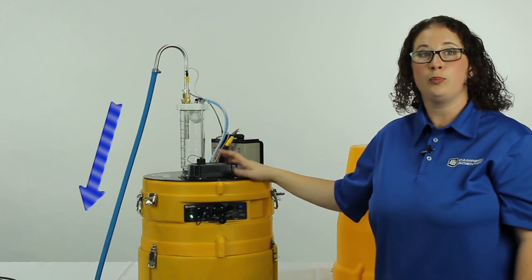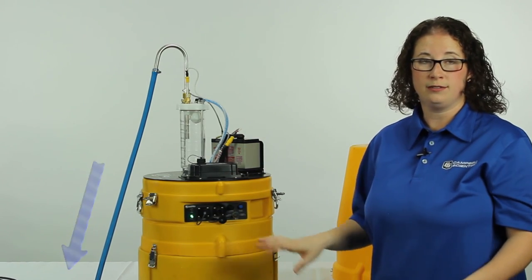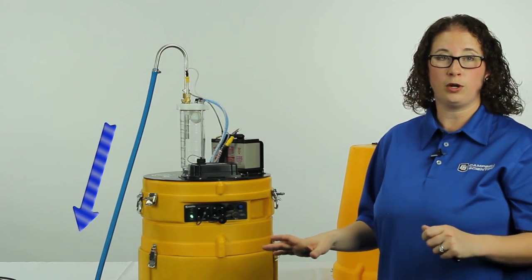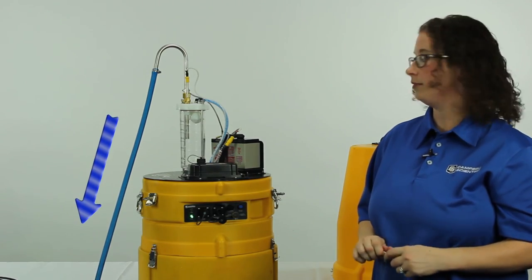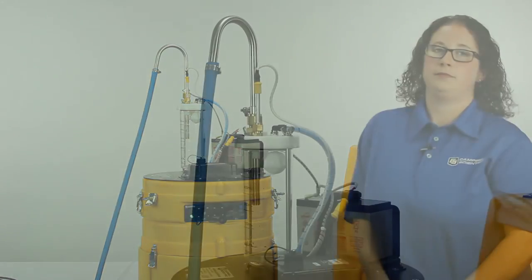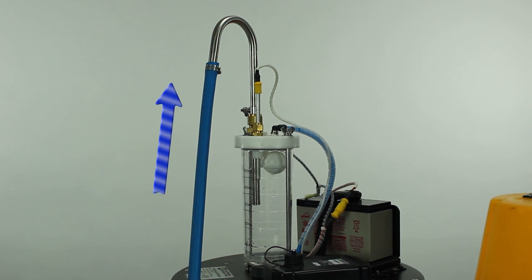The sampler is going to purge the line for two minutes regardless of how far you are from your water body. This first section is going to purge for two minutes. After the two minutes, the sampler is going to switch to pump.